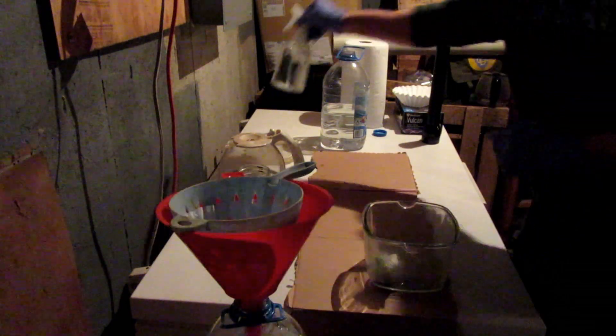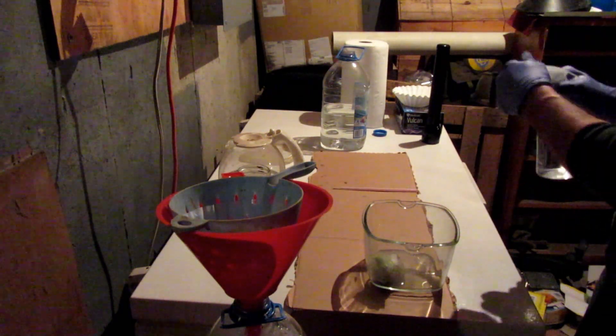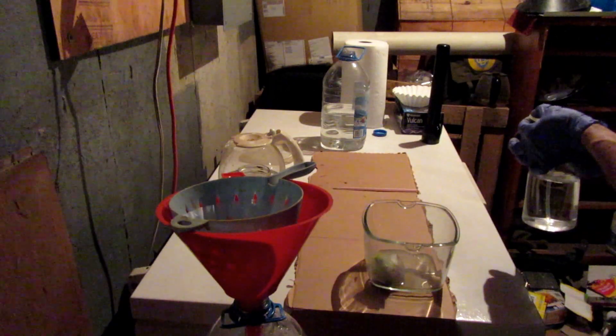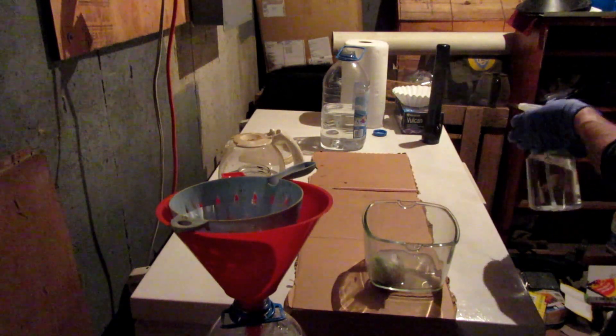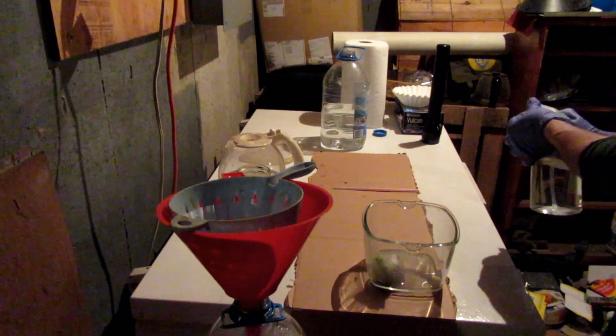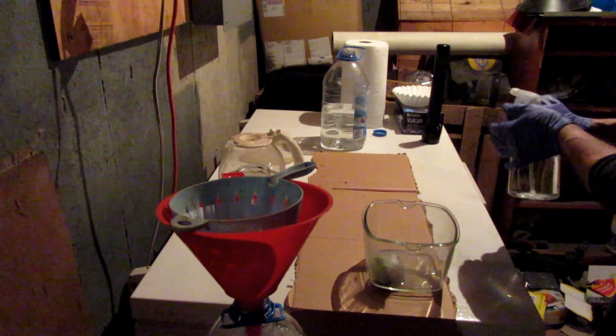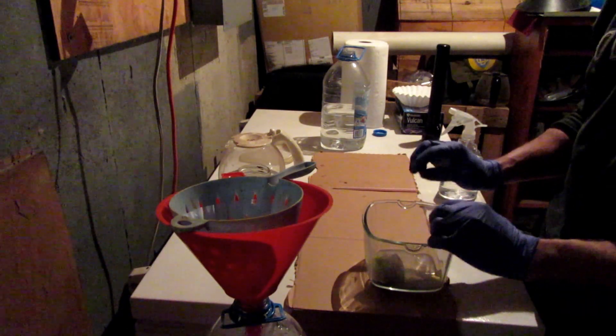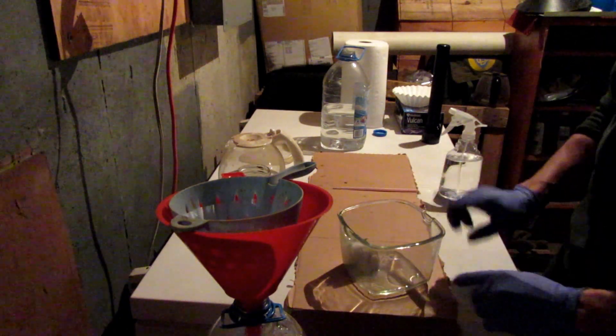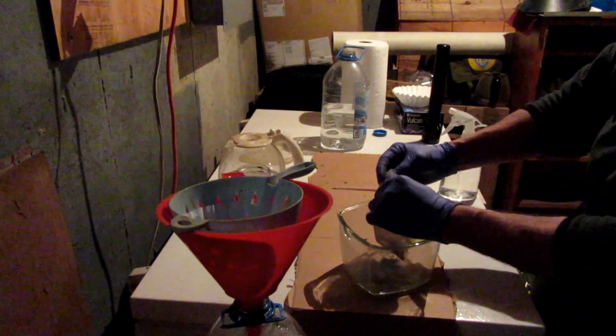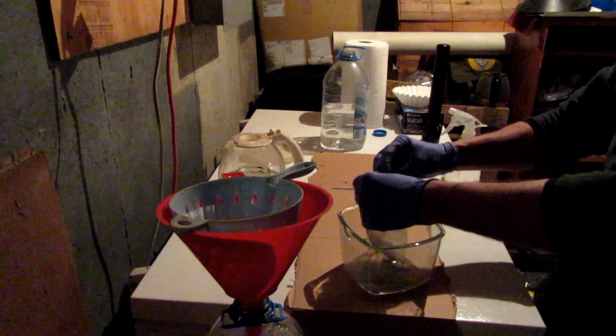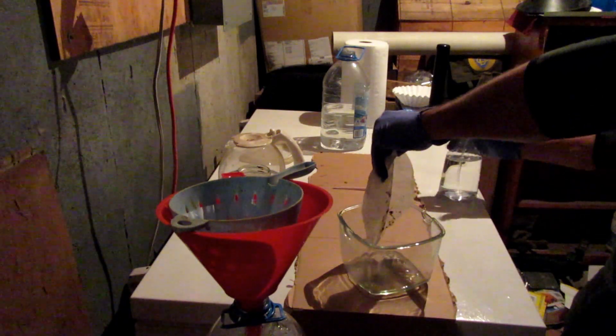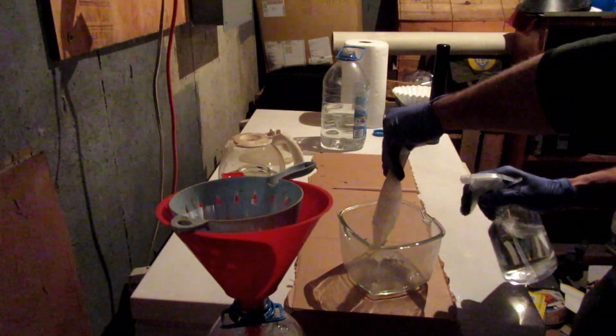So what I've got, very simply, this is water. And this particular spray I like very much because you can go right from a wide spray down to a stream, and you can pinpoint exactly what you want to hit, or you can keep it wide. So I set it at a fairly wide spray. And what I'm trying to do here is I'm trying to wash the gold side of this filter into this glass jar. So we're just going to open it up to expose the gold side. And we're just going to wash it down.